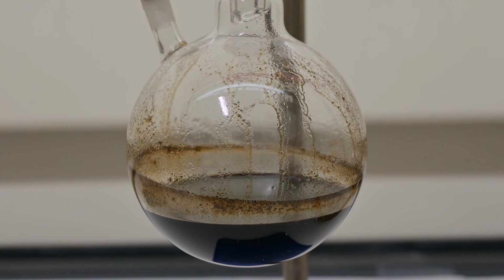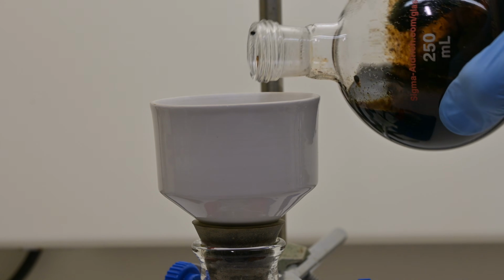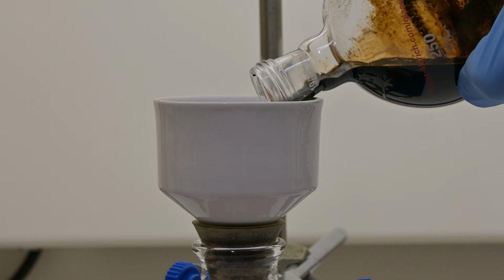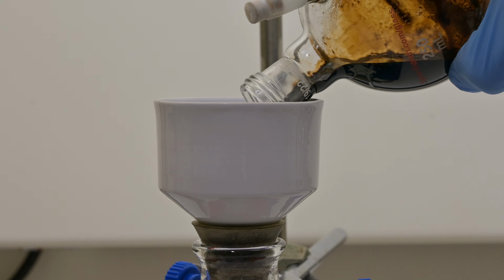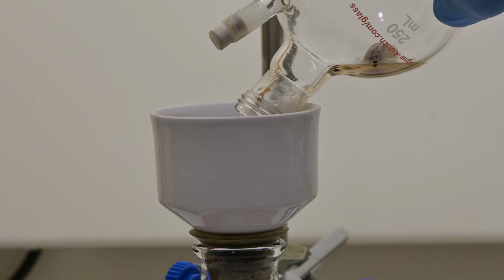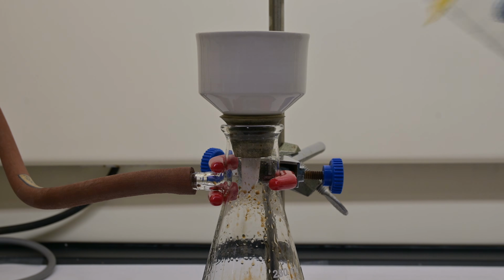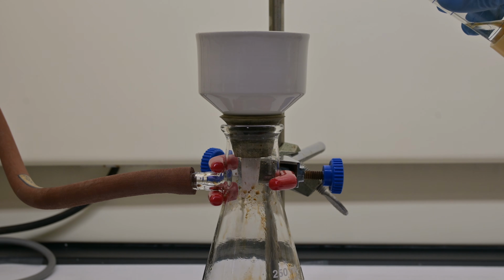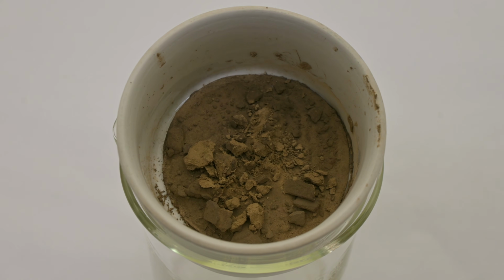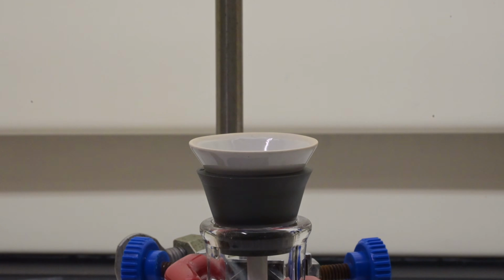After that, let the reaction cool down to room temperature once more, and then we filter out insoluble solids, which is our crude triptycene. We then give it a quick wash with small amounts of methanol water mix to help remove any impurities. Our sample was a bit discolored, so I recrystallized it using toluene.